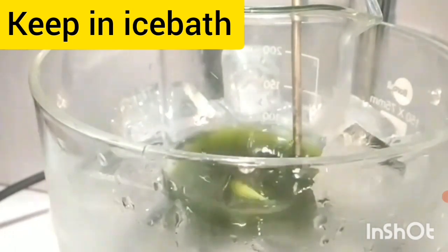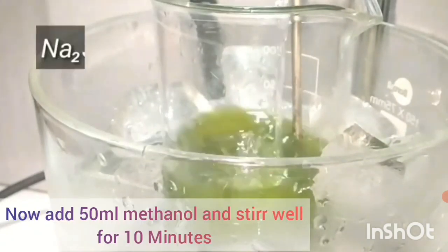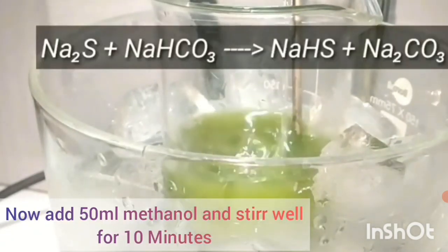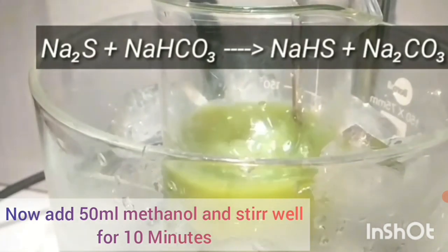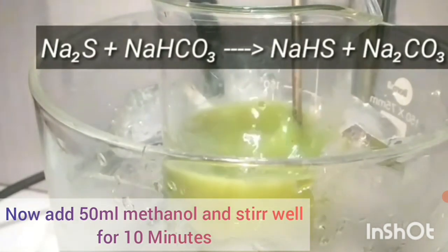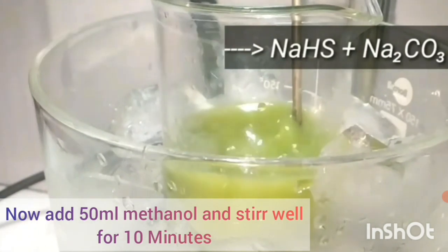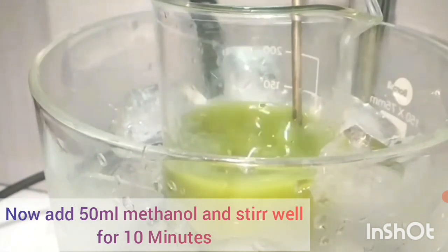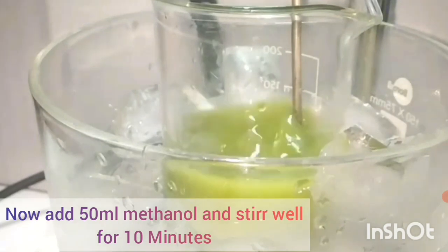Then methanol is added to the reaction mixture. By adding methanol, the Na₂CO₃ formed as a byproduct will separate out, because Na₂CO₃ is not dissolved in methanol or aqueous methanol solution.